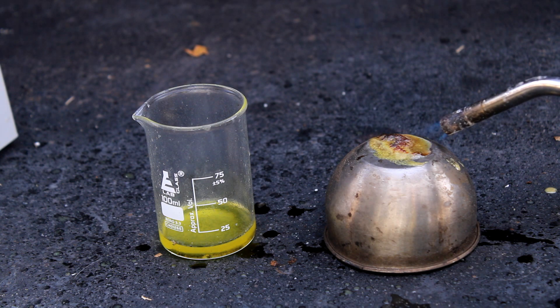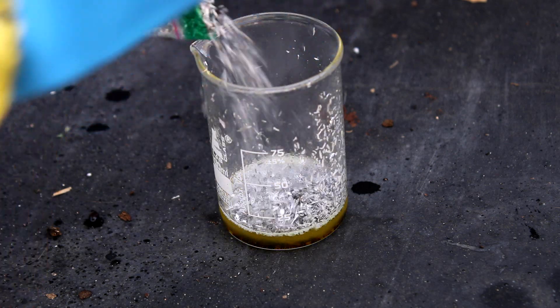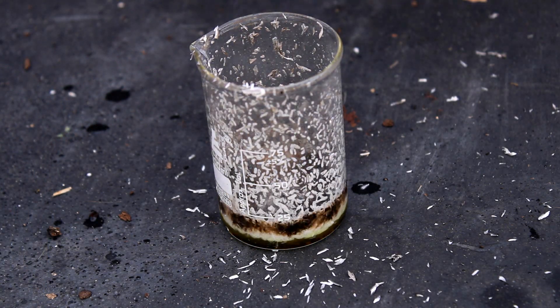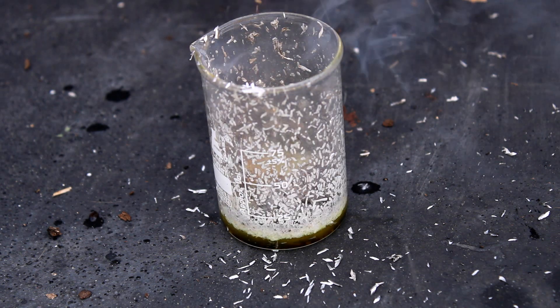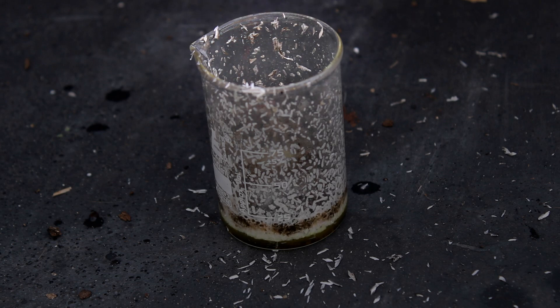Finally, I tried a reactant I knew would give me some kind of decent reaction, magnesium. And as you can see, chloric acid doesn't hesitate to show its hatred for reactive metals. The chlorine dioxide also seems to have ignited a small amount of hydrogen gas, but it's kind of hard to see unless you slow down the footage.